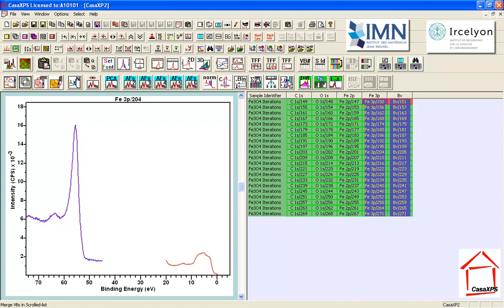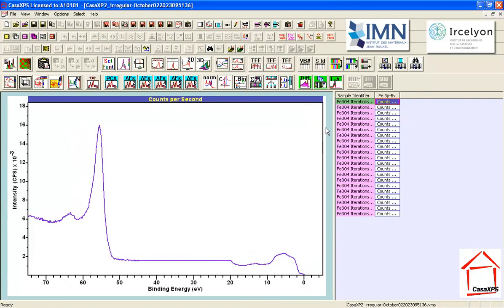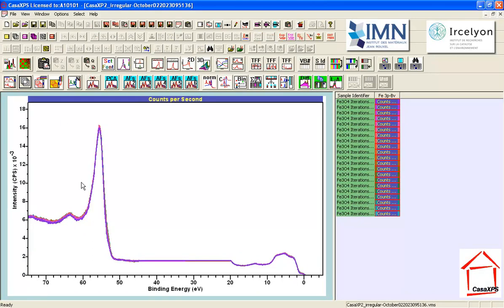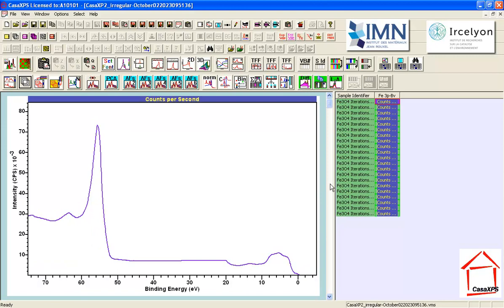So I'm going to press this button, and it asks me, do you want to do this? And I do. So I've created a new VAMAS file that contains spectra that represent a merge of the Fe3P and the valence band. And this allows me to interrogate these data using PCA. So when I press the PCA button, it will calculate the abstract factors and display them overlaid currently in the active tile, but I want to display them one per tile so I can have a look in detail at some of the lesser abstract factors.